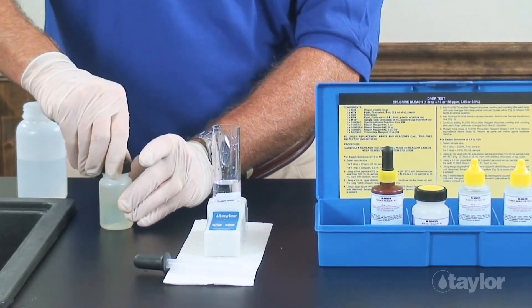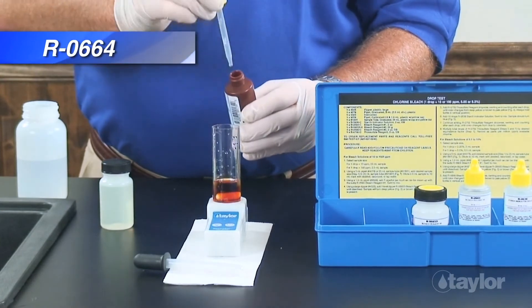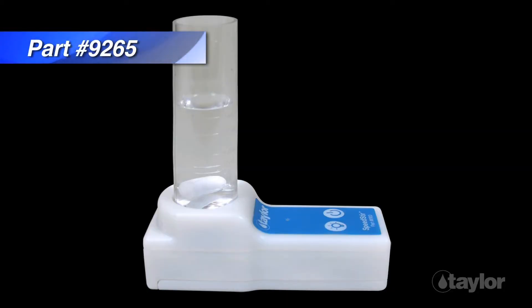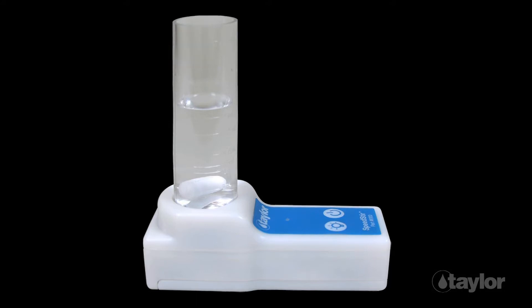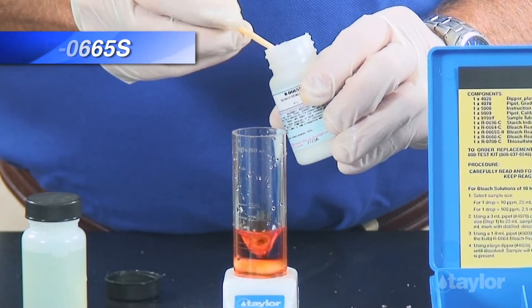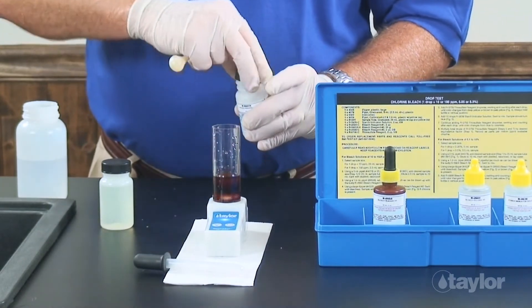Using the 1 milliliter pipette, add one pipette full — as much as can be drawn up with the bulb — of bleach reagent number one. Swirl to mix. For this demonstration we are using Taylor Speed Stir, which is sold separately, but you can always manually swirl the sample. Using the large dipper, add one level dipper of bleach reagent number two.